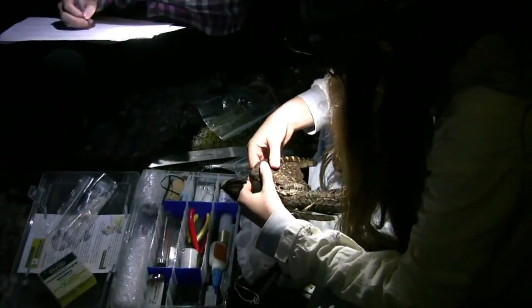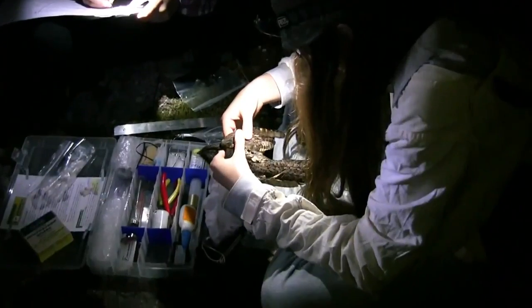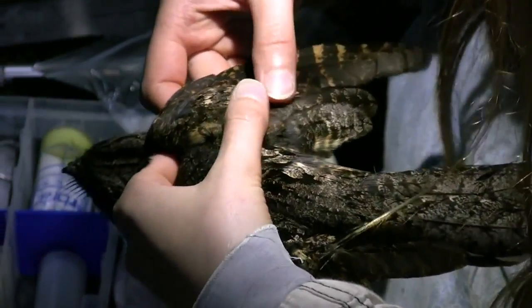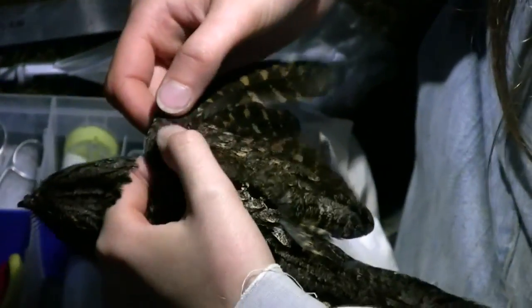Secondaries are old — hang on, those are all extra old. And the last two are just old. Gotta get all these generations figured out.